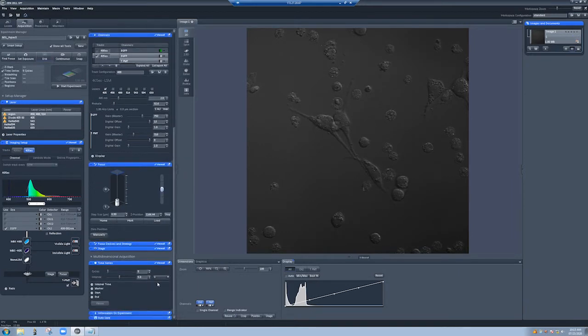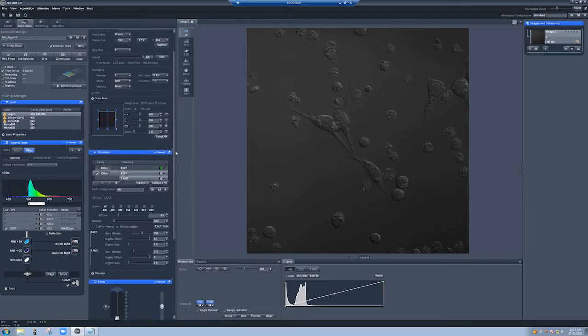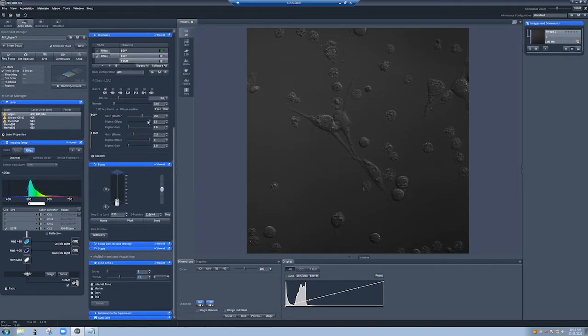Once I have the time series set up, what I can do is click Start Experiment, and it will take the images that I told it to. So to make this video not so long, I'm just going to do 3 cycles. So I'm going to take 3 images spaced 5 seconds apart. You can see that the scan time for each image is about 1 second, so there will be enough time to do this. And actually, since it's 1 second, why don't I do 1 second intervals and take 10 images. All right, just for the sake of showing you how that looks. So let's say start experiment. You can see here the time remaining.